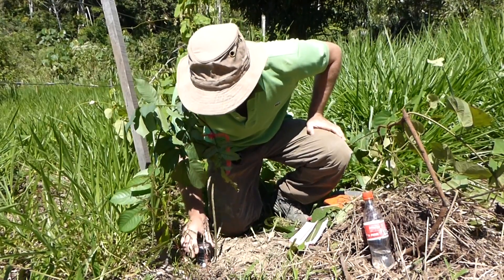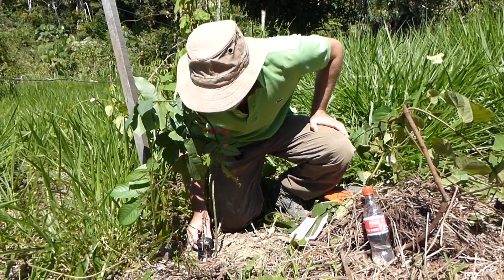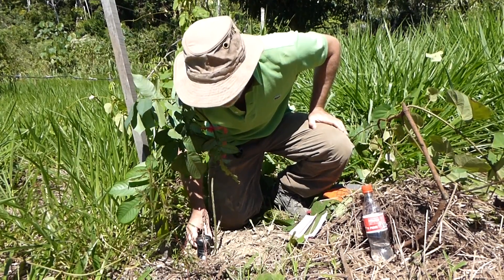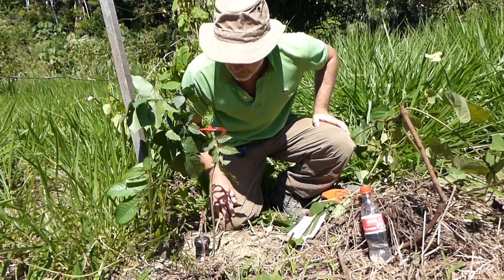Having a look now — it seems to have stabilised, it's no longer moving. The pH here is 6.4. So that's the pH measured.